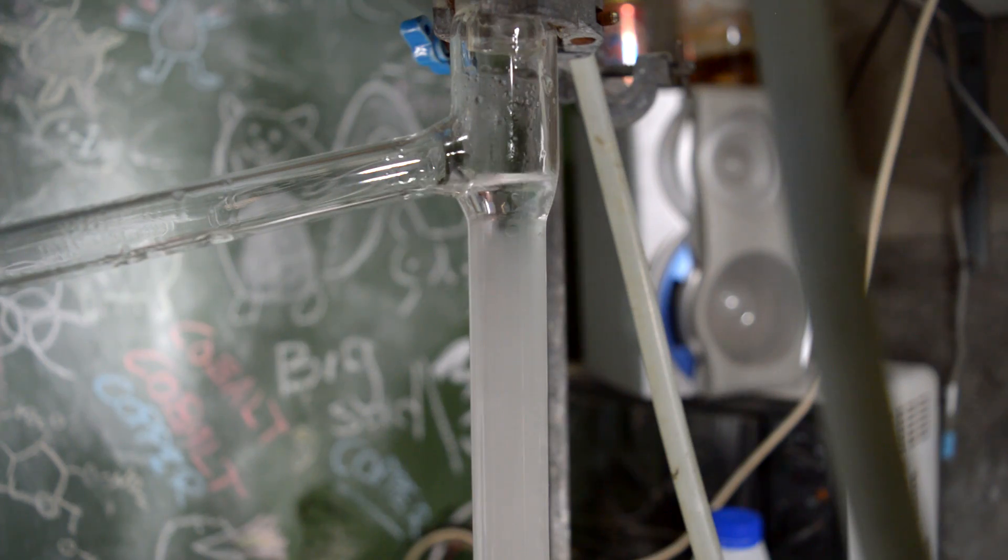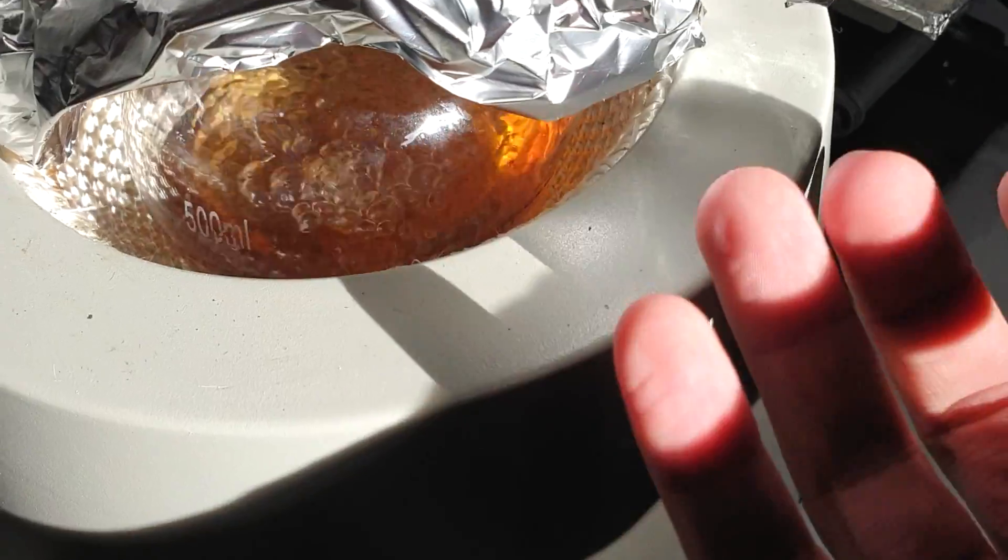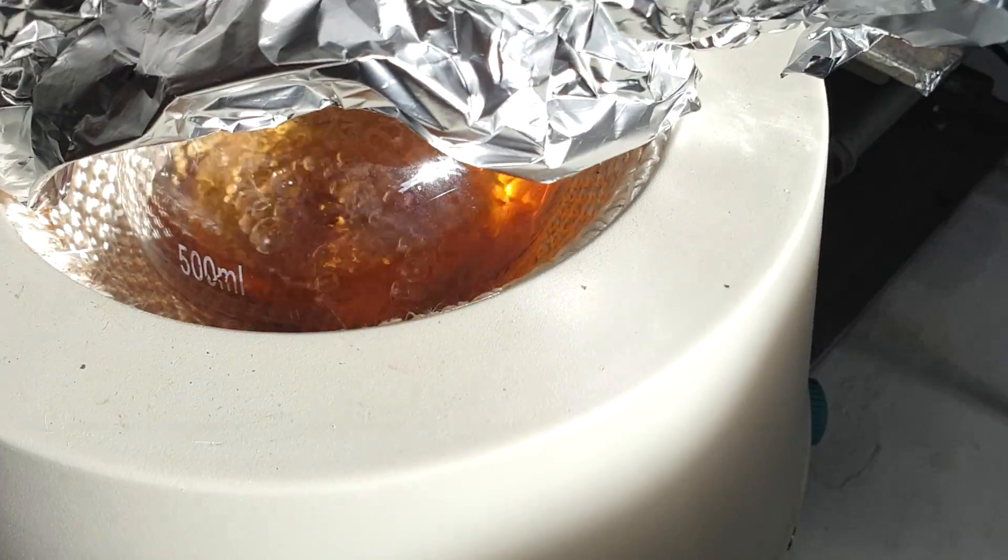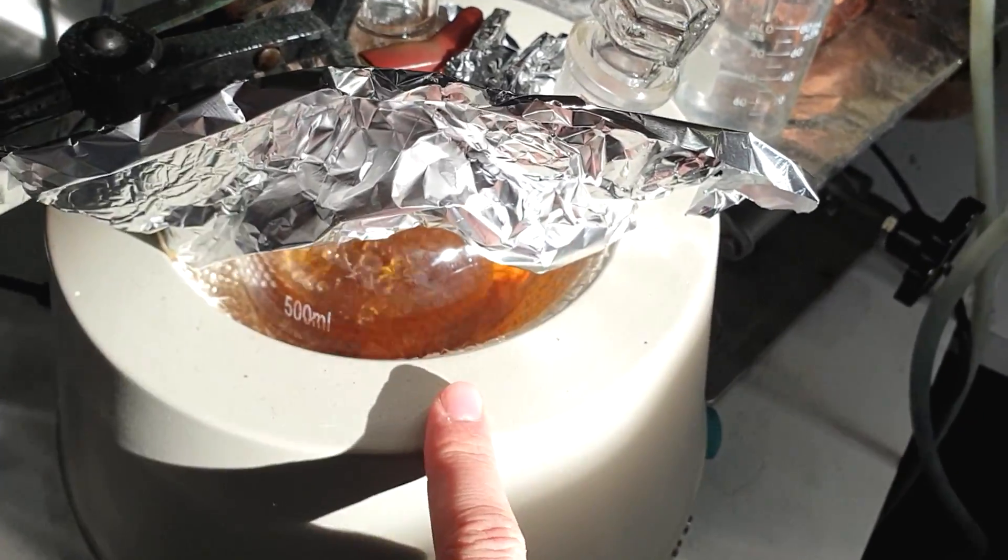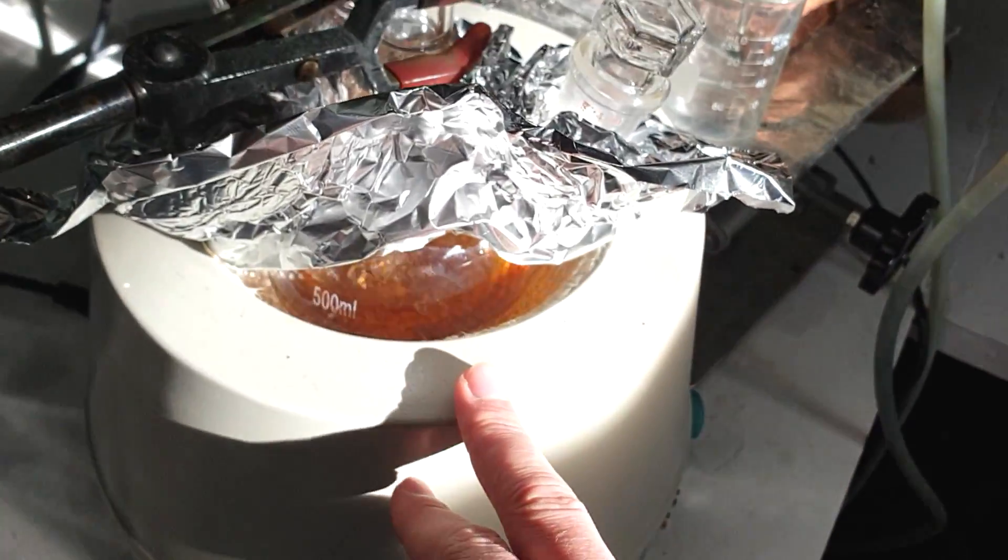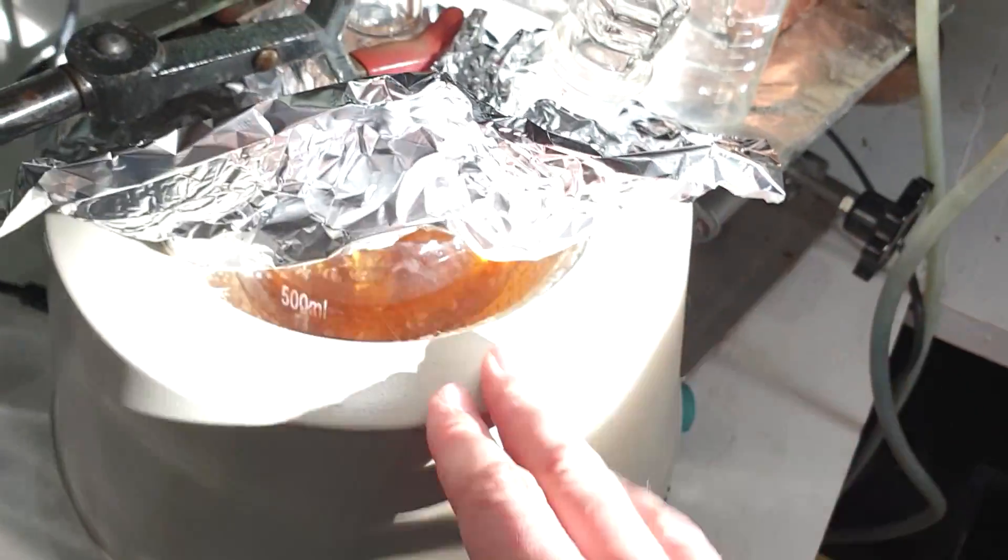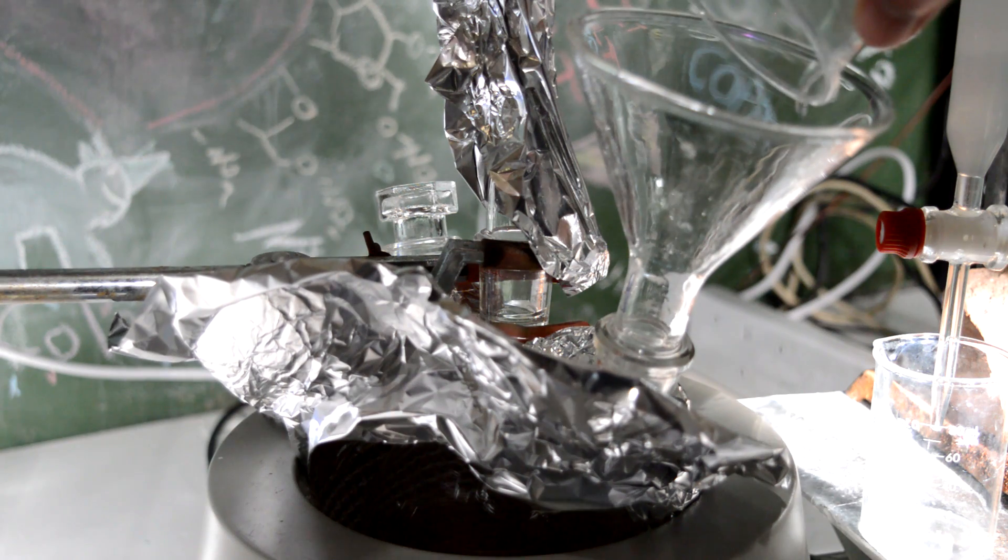It's developing a red crust around the outside. It's dissolving into the solution and forming that orangey-yellow color. I wonder if the ketones are doing something weird together because it's not enough ethylene glycol, which is a concern. So I'm just going to put the rest of the ethylene glycol in as per the paper did it all at the start. Maybe there was a reason for that.